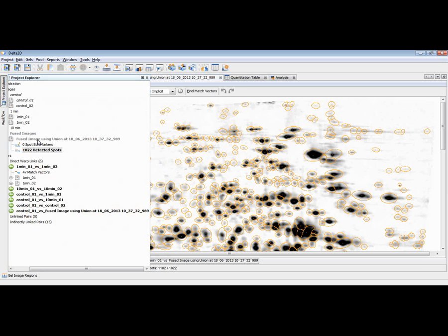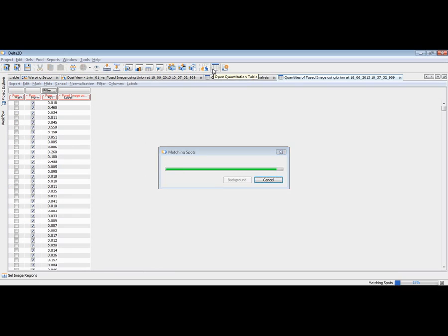In the project explorer, we have the fused image also added to this project, and we can click it and open a certain quantitation tool only including this image. I now want to see the spot quality column as well, sort for this spot quality column, and then those spots which are very untypical. They do not have a typical bell-shaped distribution if you cut them in pieces, and then this is of very poor quality, while the others on the other end of the table, I sort it the other way now. They should have a very nice shape and they look very typical like a real spot.